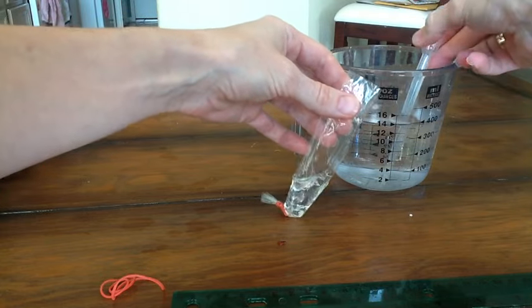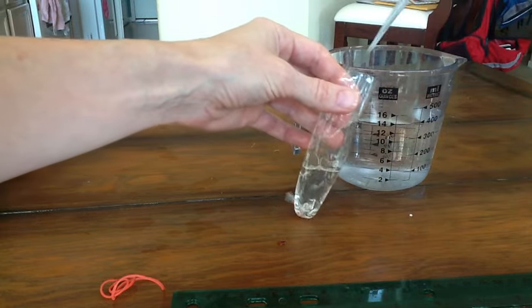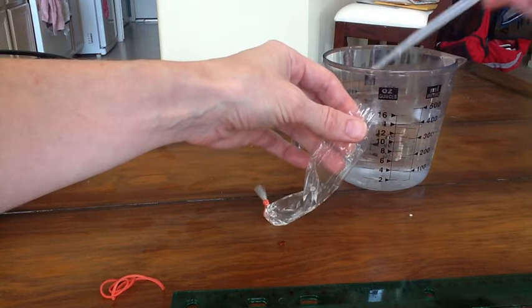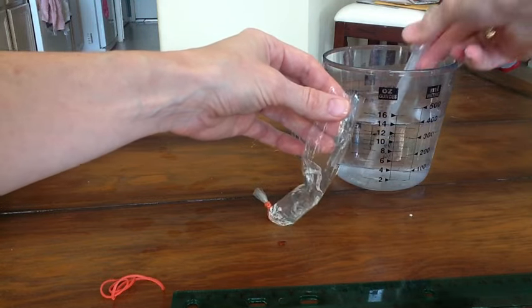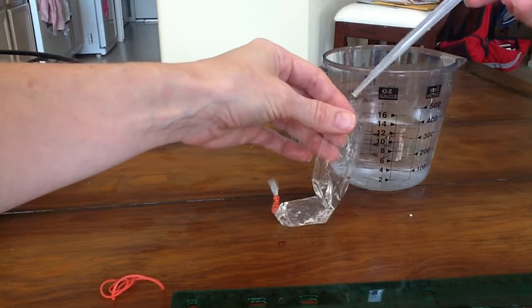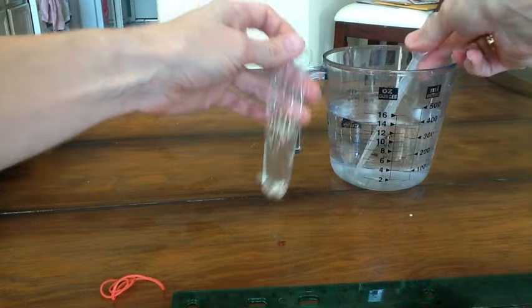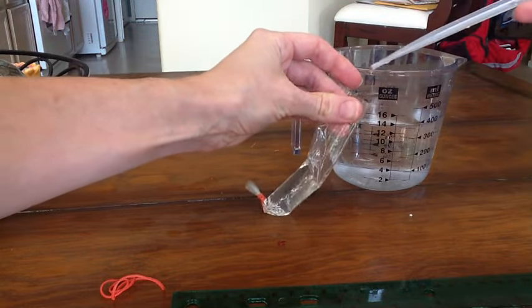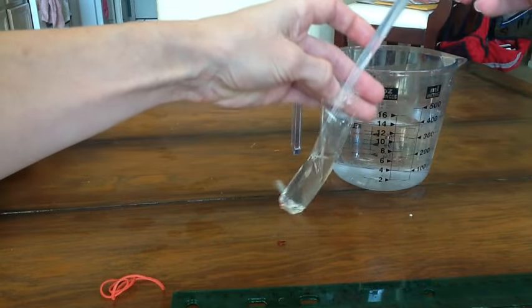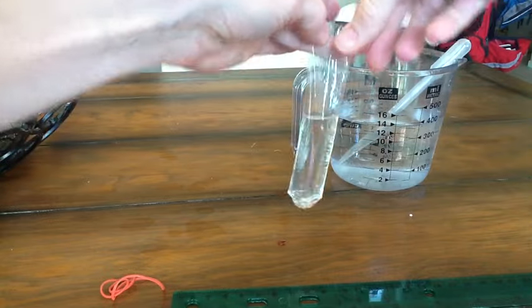If you have larger pipettes at your school or your facility wherever you are preparing this, they might fill up the bag a little bit quicker. This is what I had on hand today so let me give it one more. And now I've got a bag.